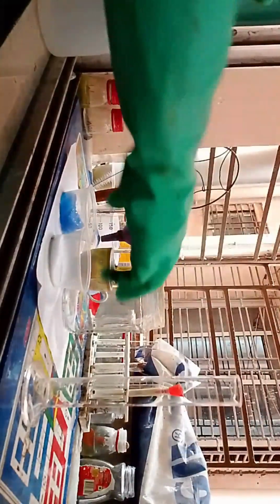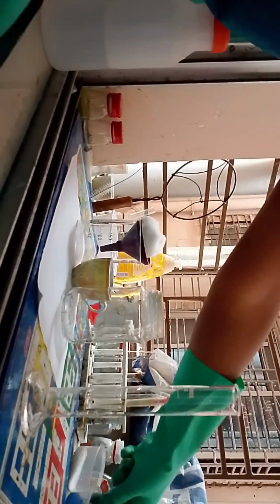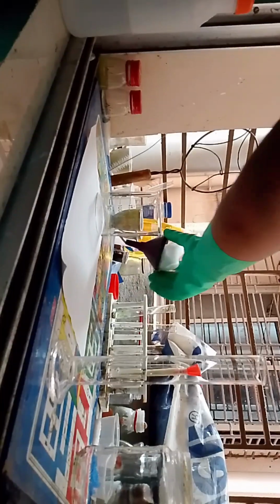Okay, so first thing is to take this dropper away. The measuring cylinder, we need it. Keep the two chemicals away for now because we will be using them a little later. Keep the second jar away, our funnel system, Celite and cotton away, and only this beaker and this guy. This is the measuring cylinder with a 50 ml mark.